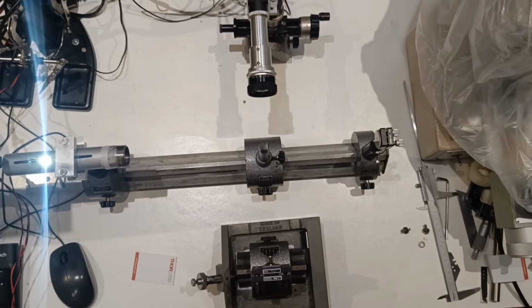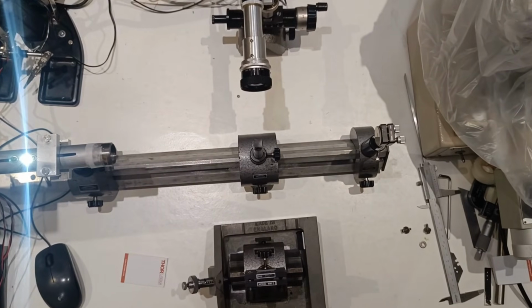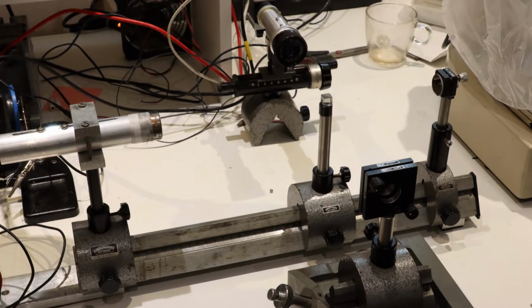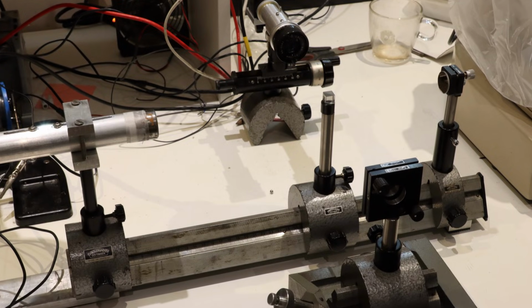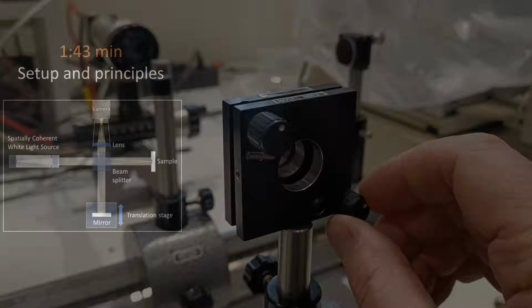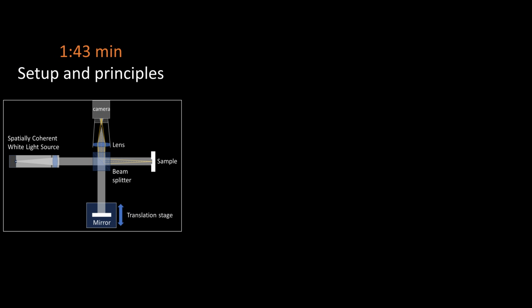To discover how a coherence scanning interferometer works, we're first going to build one ourselves. Now don't get me wrong, I'm not going to build a high-end instrument for this video, just a simple setup to illustrate the principle. And during the build I'll try to explain the backgrounds in quite a lot of detail.